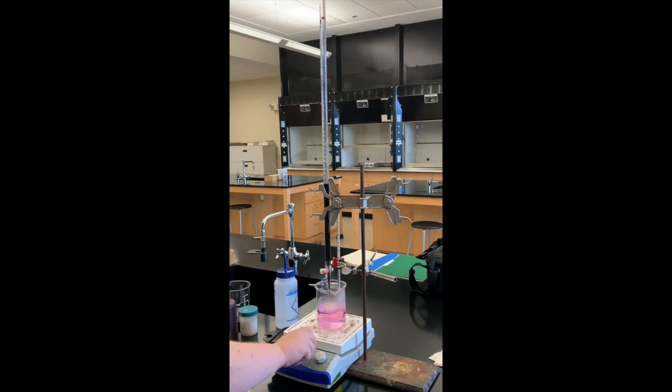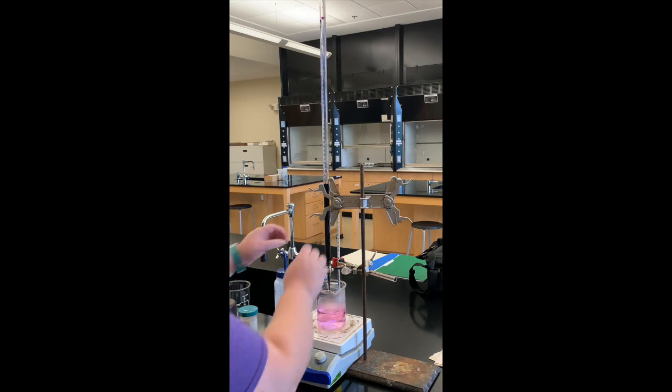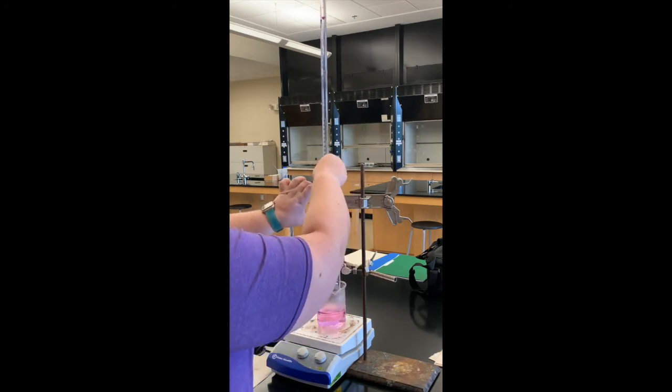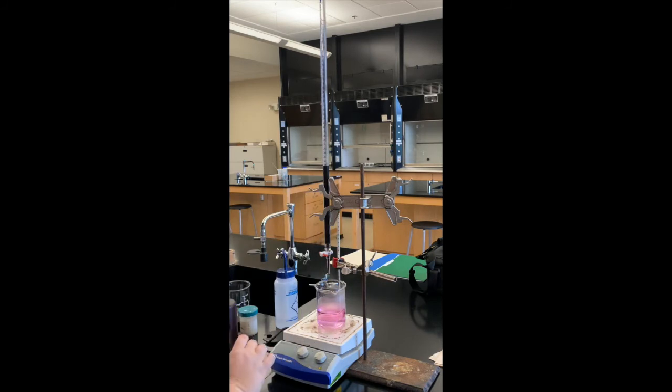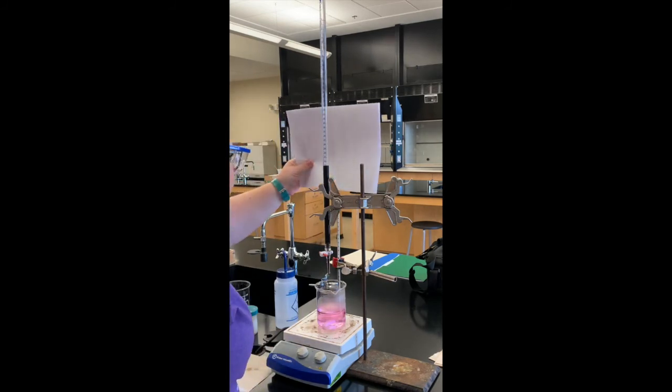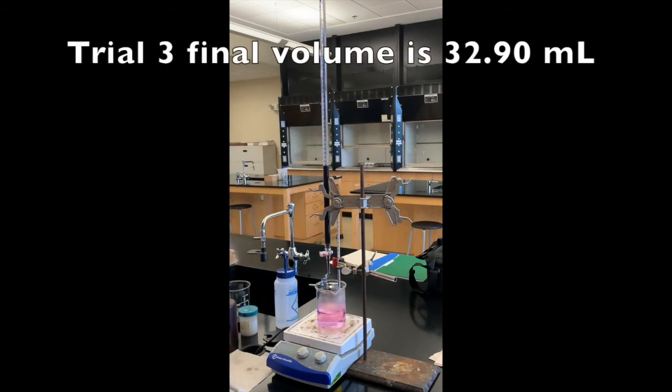Okay, so we have reached the endpoint of trial three. So I'm just going to turn off the stirring and the hot plate and then read the final volume for the titration. 32.90 milliliters.